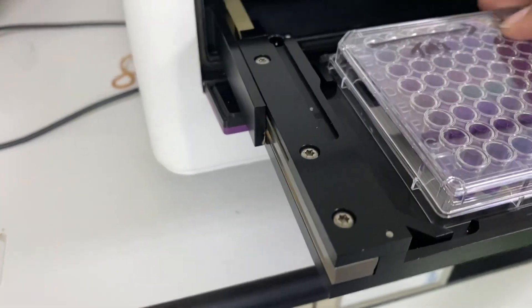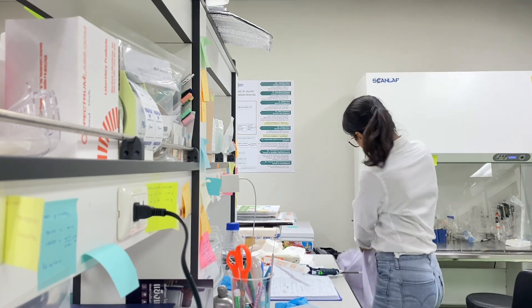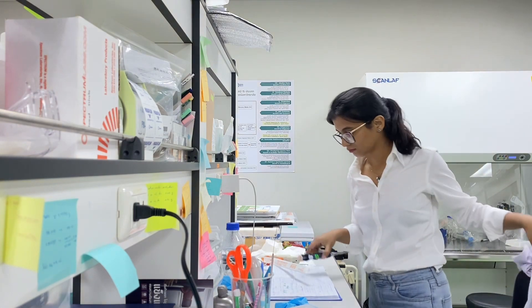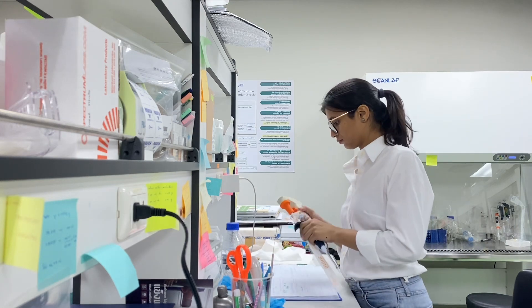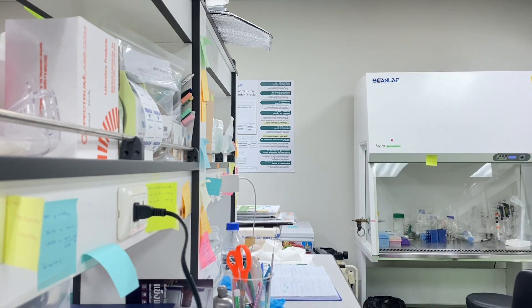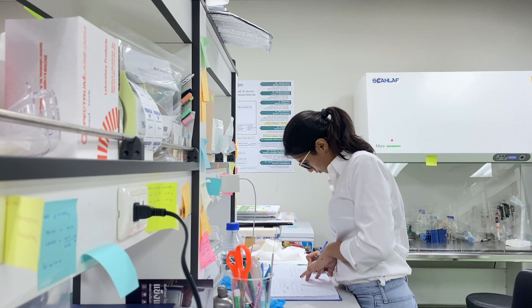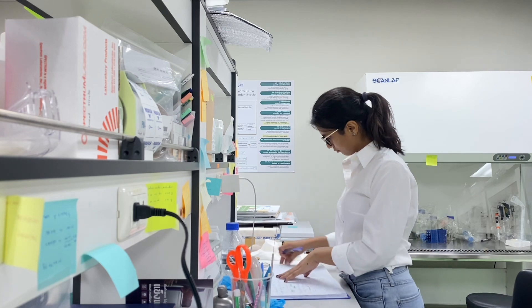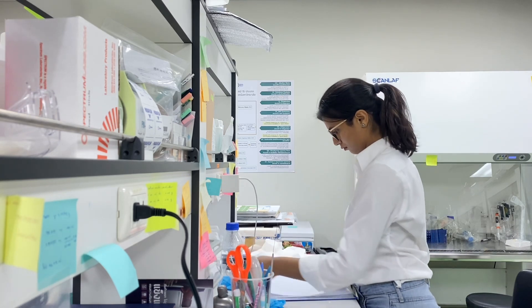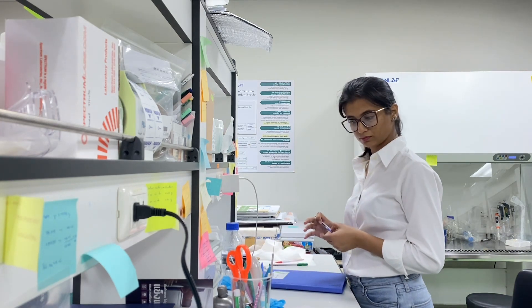Now it's time to remove the plate from the microplate reader so I can turn it off. I'm back at my own lab, done with all the practical work. I already have my readings. I removed my lab coat and I have to place all the equipment back in their place. It's very important to document each and every step of an experiment — it helps you track down mistakes, old protocols, and changes. It's very important for a scientist or researcher to keep a record of every experiment.